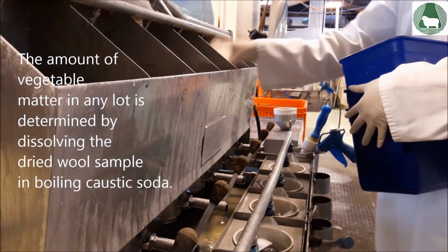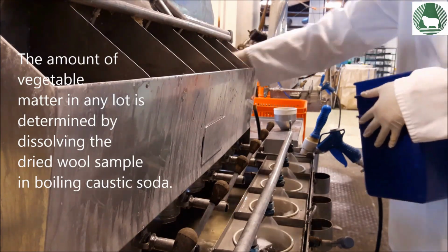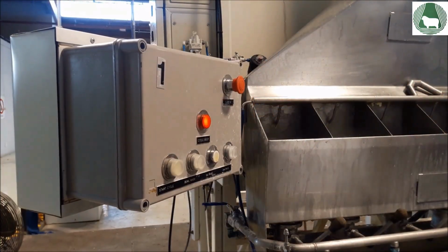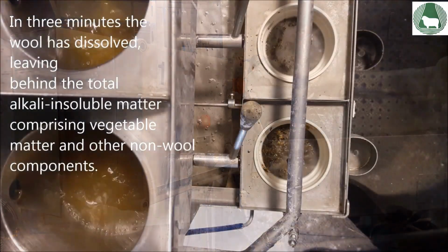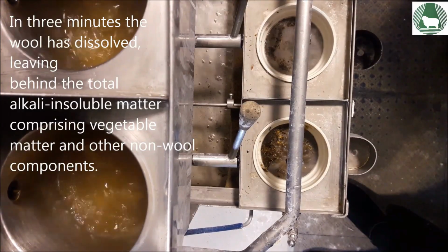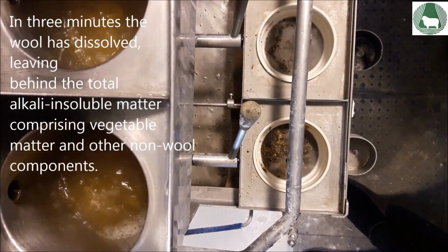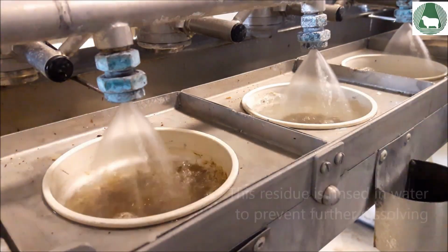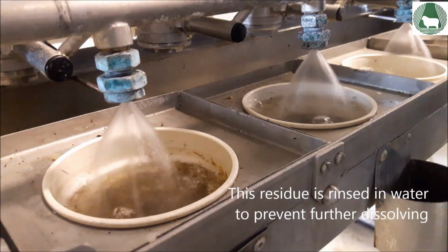The amount of vegetable matter in any lot is determined by dissolving the dried wool sample in boiling caustic soda. In 3 minutes, the wool has dissolved, leaving behind the total alkali insoluble matter comprising vegetable matter and other non-wool components. This residue is rinsed in water to prevent further dissolving.